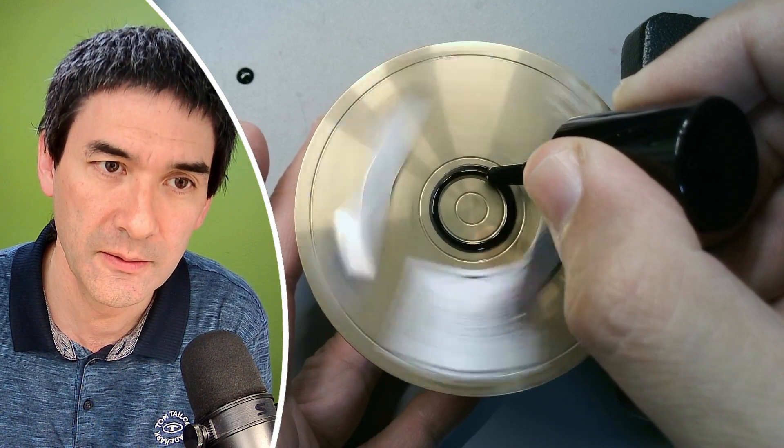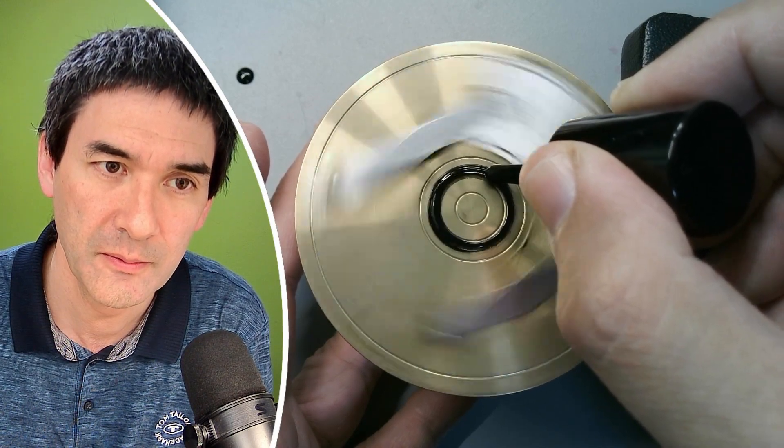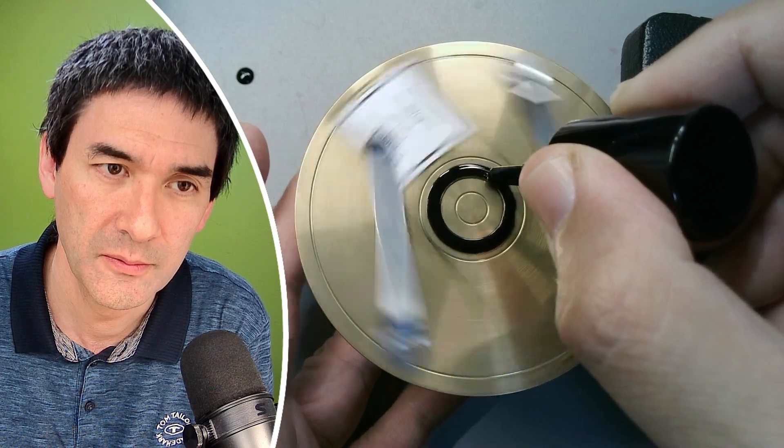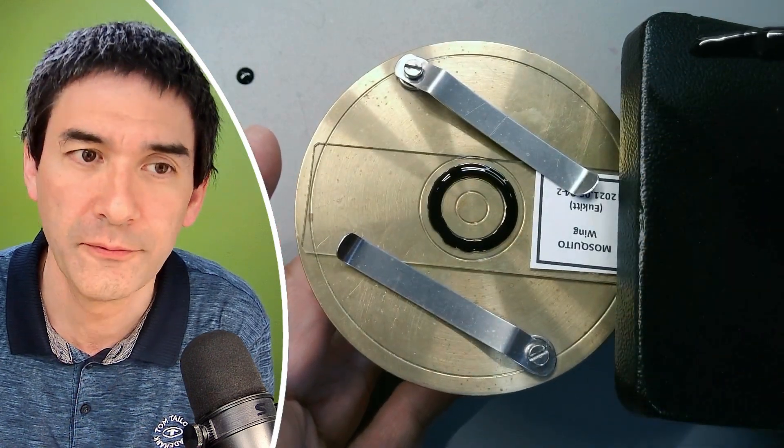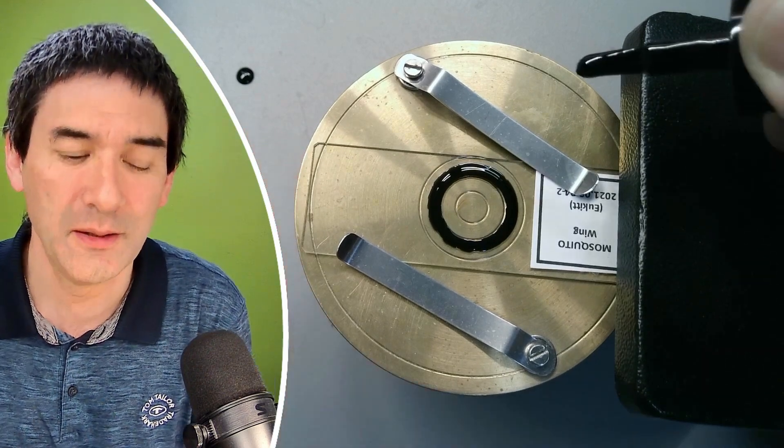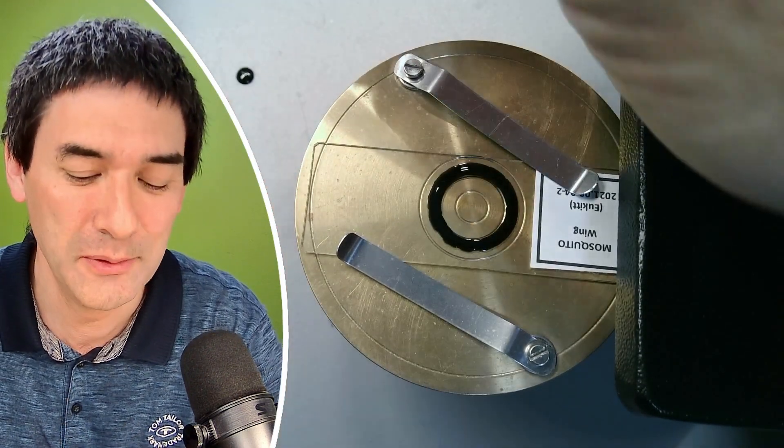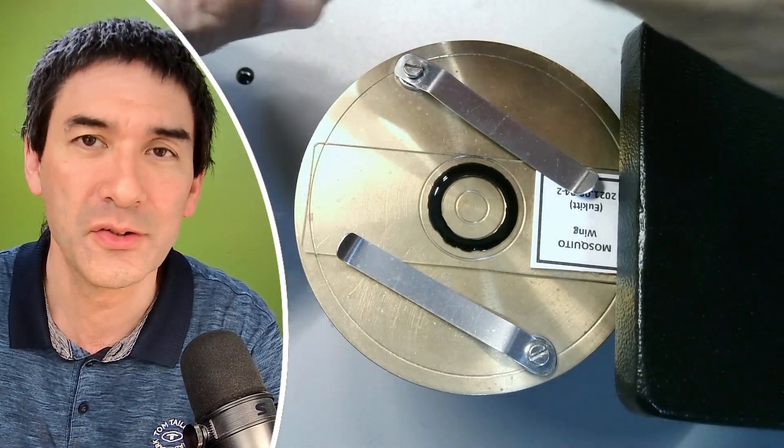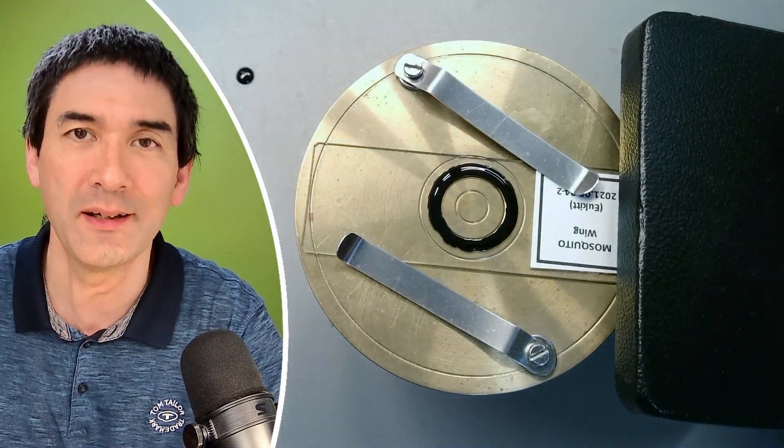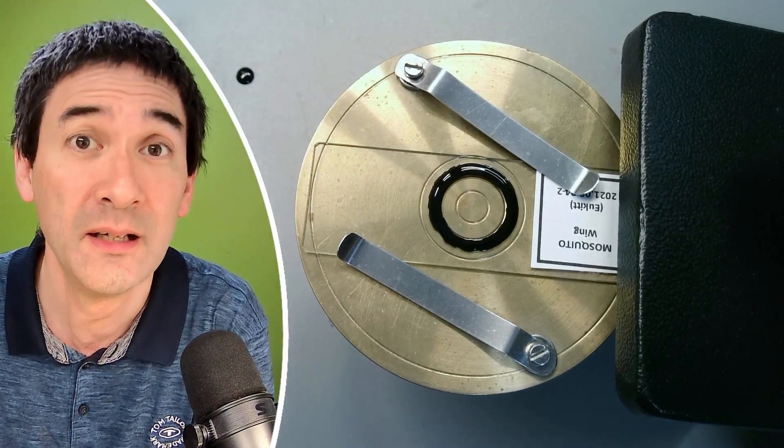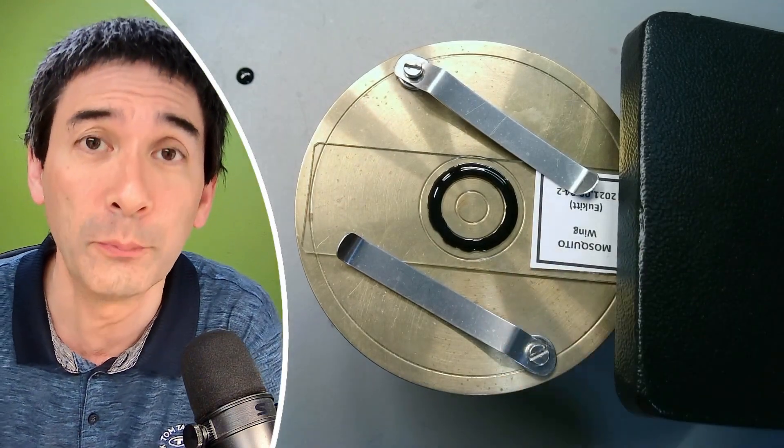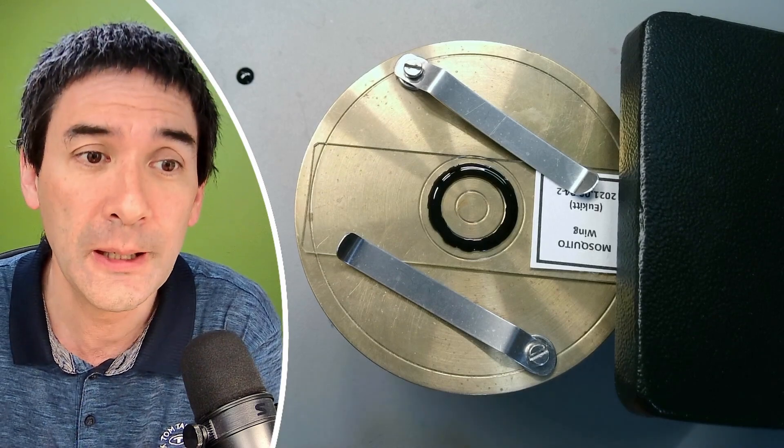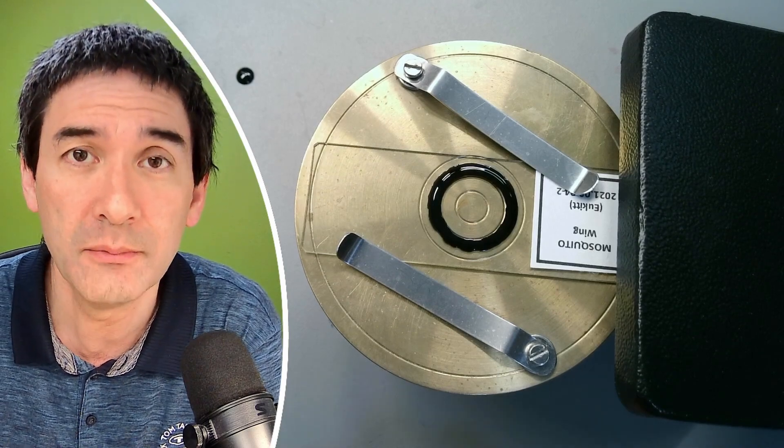And I think it's going to be kind of fine, okay? You see, it's dangerous if you have a little bit too much and probably you would like to use a finer brush as well. So basically the idea is you can experiment around with it, and if it doesn't flow properly, you have to add a little bit of solvent, a nail polish remover or acetone, and then basically you'll be fine. And in the past, I've sometimes also applied the ring several times. I allowed it to dry, and then I applied a second layer on top.